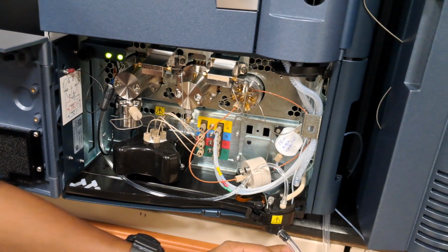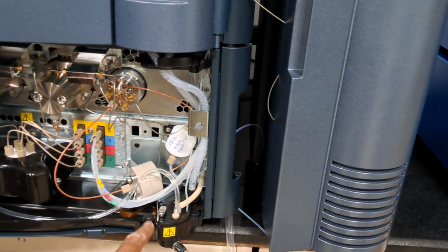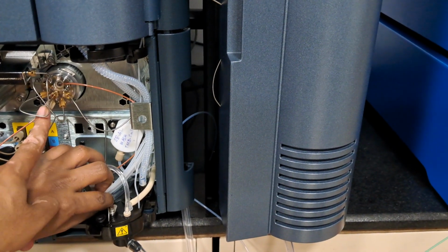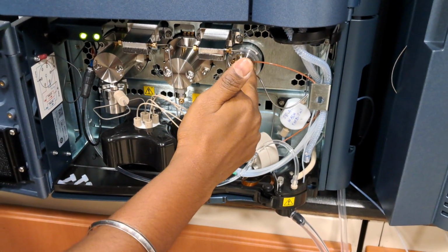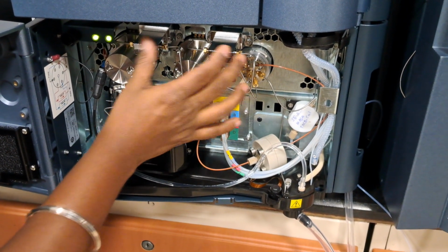The flow comes through here. Can you show this priming channel? Here it is coming, right? No, it is coming from the top side to here, the degasser. Again, it's going to the pump, then to this valve. It gets its pressure sensed by the pressure sensors.